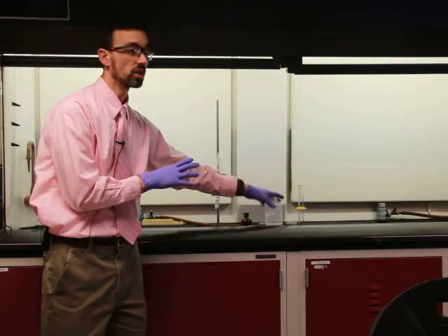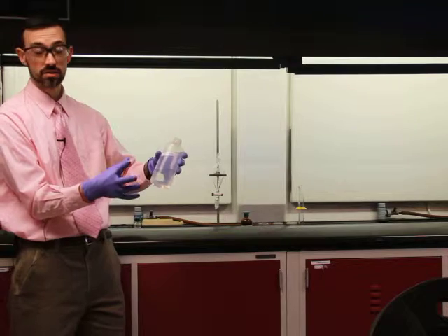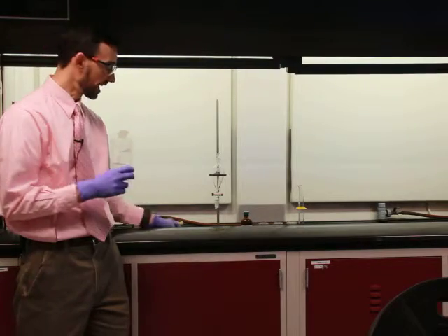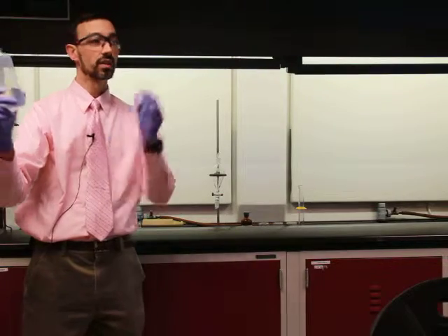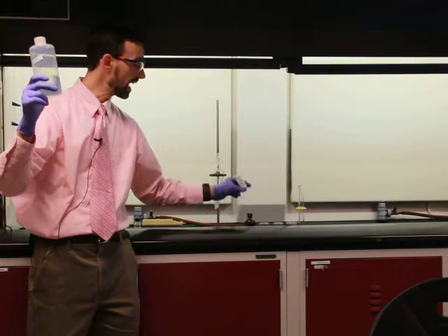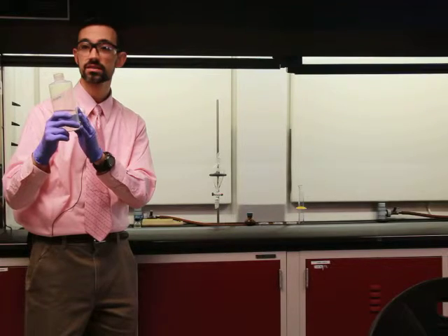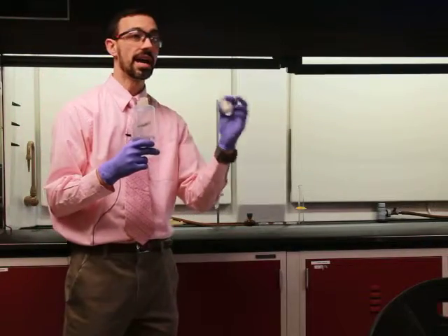And then the other thing we'll use is a solution of sodium hydroxide. It's in water, so it's very polar, and it's also a base. We haven't studied acid-base chemistry yet, but the acid that's in here will love the base that's in here. So even if I put this into ether at the start, which I'll do, when I introduce it to this, all of the acid molecules will jump out of the ether into the base over here, because opposites attract, so to speak. And that's going to be how we're extracting. We're pulling the acid out of that mixture.